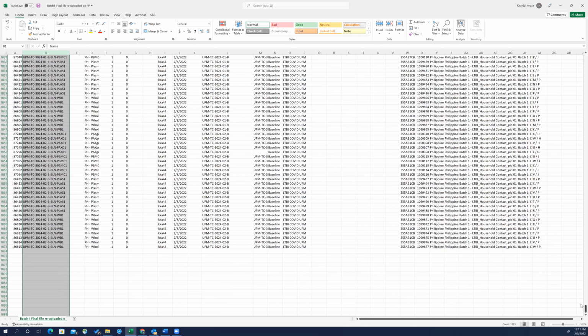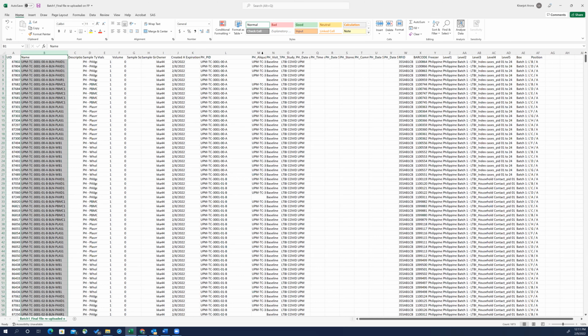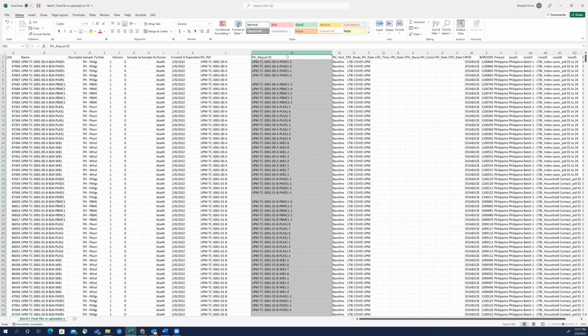All right, so it seems like all the ones over here have this change already, and I'm going to do the same for this one. So again, it's the same thing. There are multiple aliquots of this PAXD. Another method I could have done is instead of going with this, I could have gone with this and then added BLN prior to PAXD1 or PLAS, PBMC1, but I think it will be way quicker to do it in this manner.